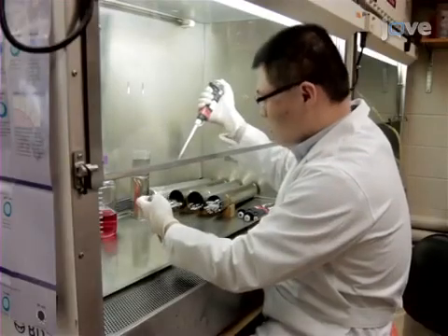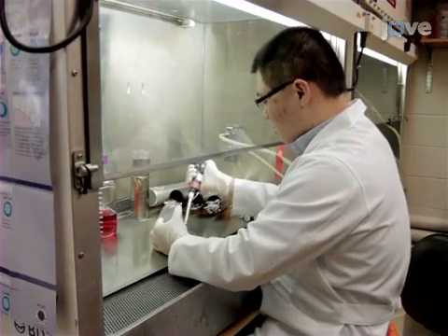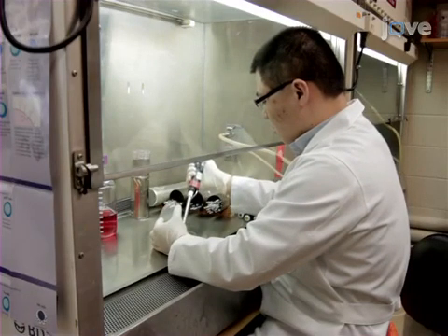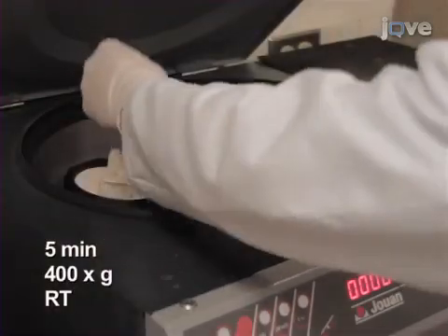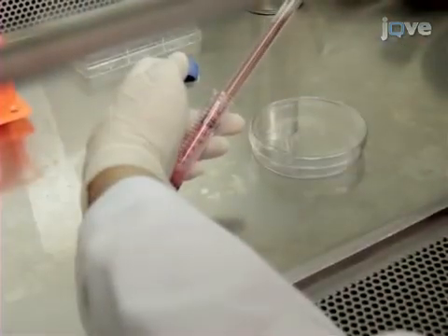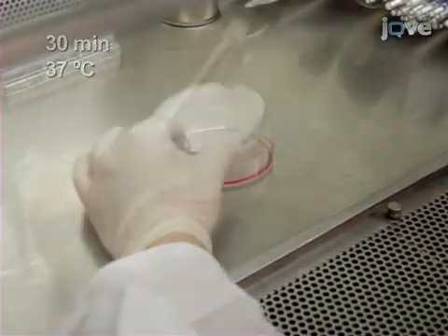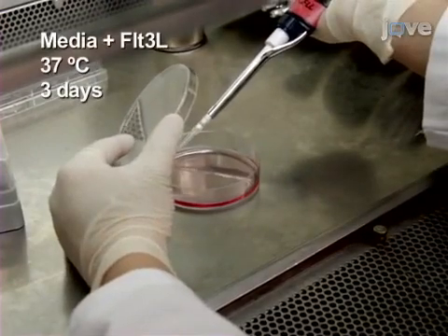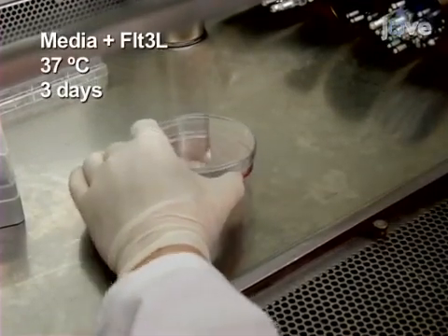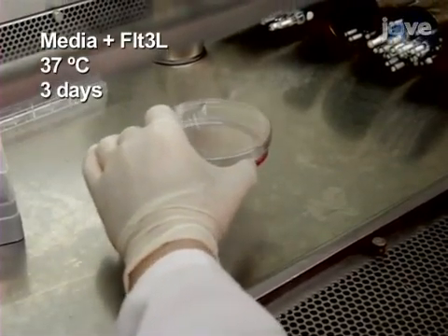On day 0, transfer 5 × 10⁴ iPS cells onto a 100 mm culture dish containing a confluent OP9DL1 cell monolayer in 20% FBS alpha MEM media. On day 5, trypsinize, then centrifuge the cells. After incubating them on a fresh 100 mm culture dish for 30 minutes in a 37-degree incubator, plate 5 × 10⁵ of the floating cells in 20% FBS alpha MEM media and mouse Flt3 ligand on a new 100 mm dish containing a monolayer of OP9DL1 cells.